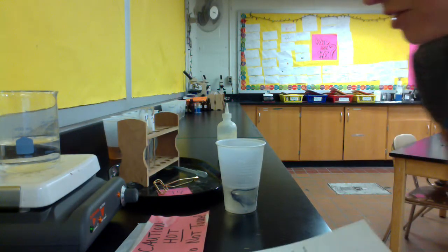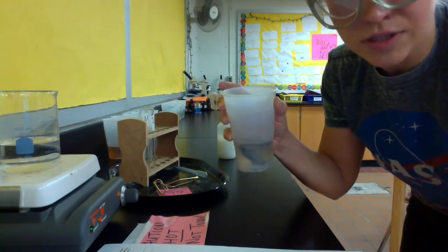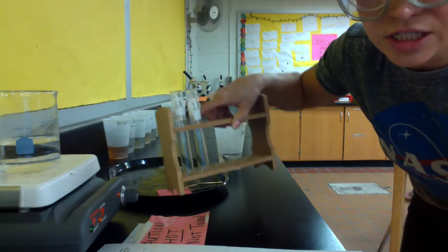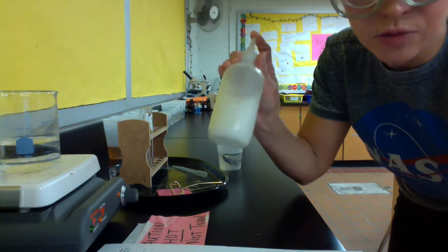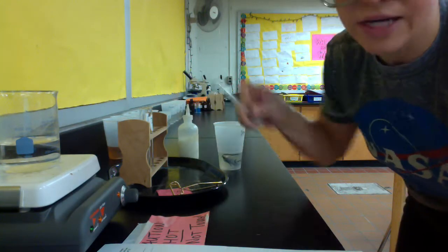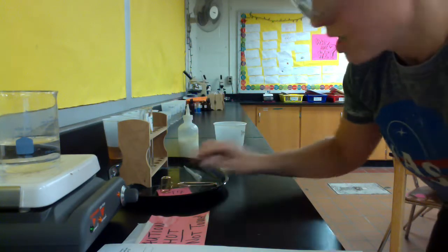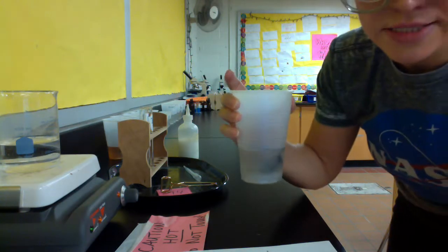Here are your materials for today. You will have your cup that you worked on in the last lab when you made the cell. You're going to have a test tube rack, and we're actually going to use 2 test tubes today. We will need this solution that we used yesterday for the inside of the cell to verify its contents. We're going to have a dropper pipette like this, and we'll also have a test tube holder that we used the other day.